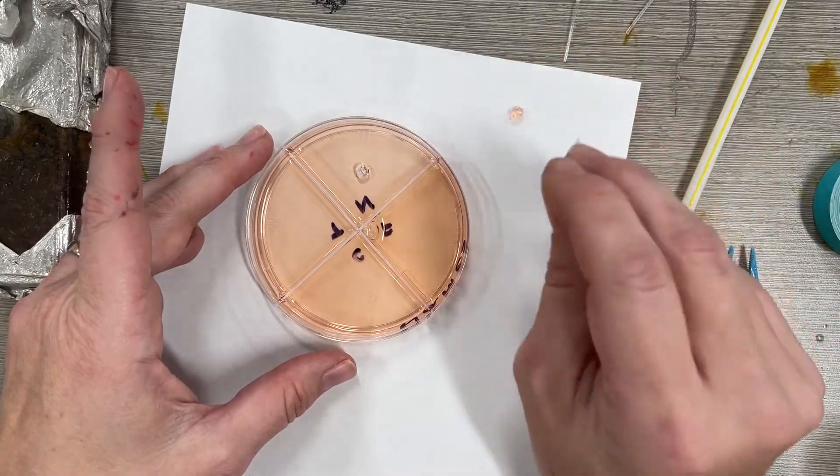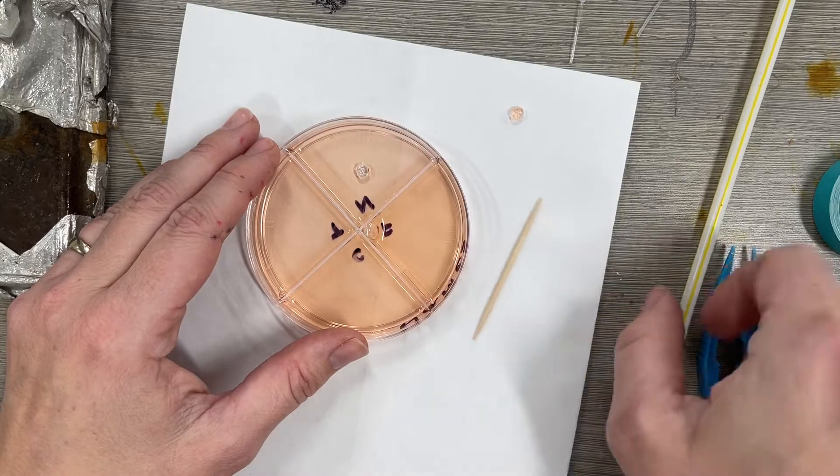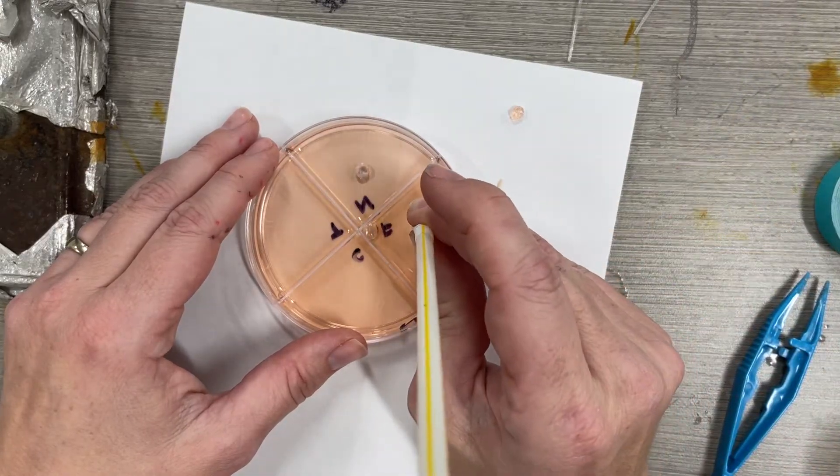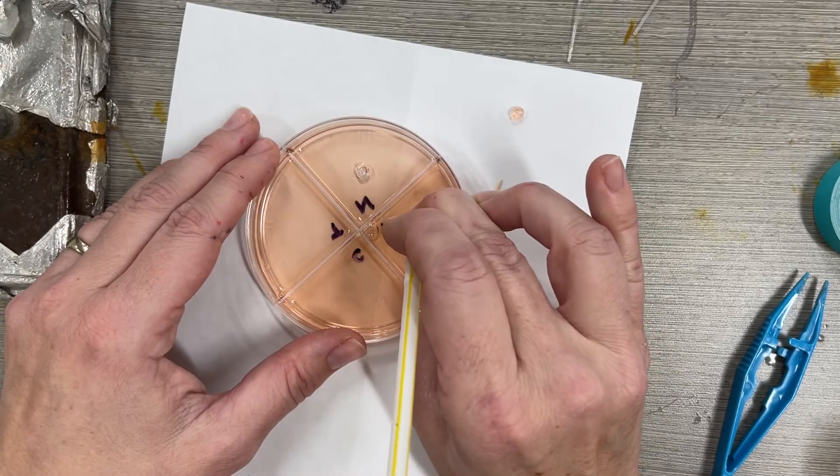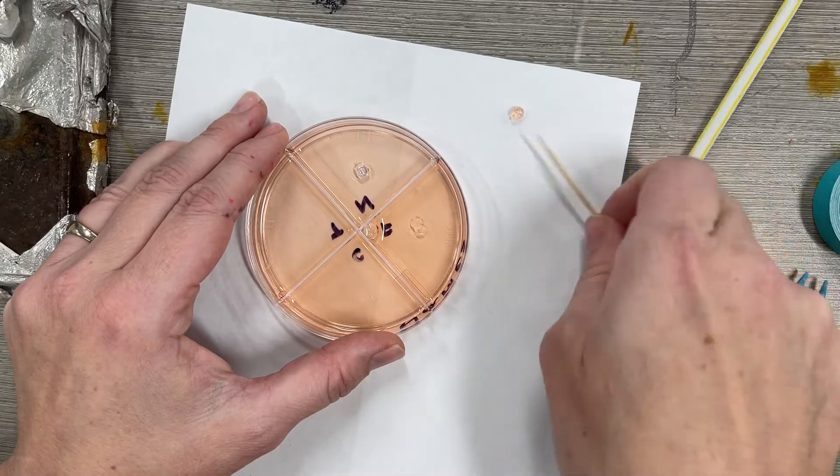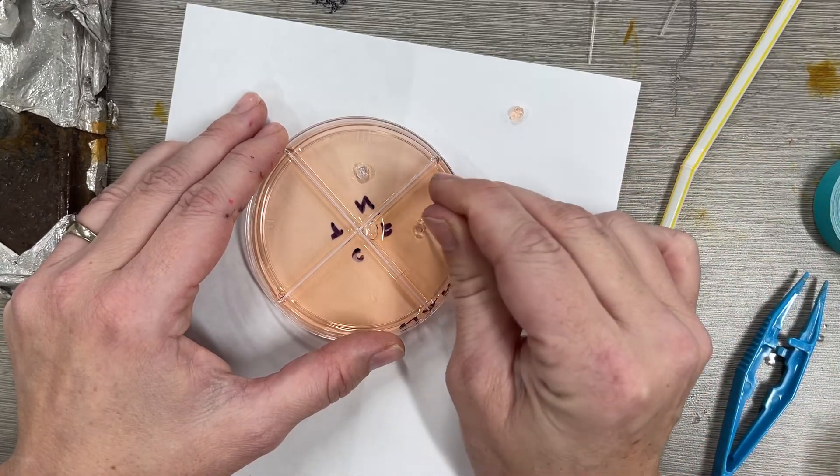Like that, going to reinforce the hole just by going around like that. You're going to do that for each of these four wells. Pinch the core, suck the sample out when you remove the straw. Sometimes it works, usually it doesn't, so I'm going to use various tools to get this core out. There we go.